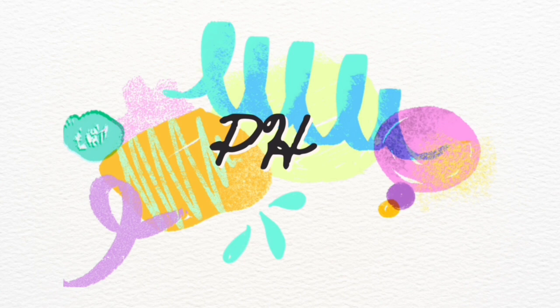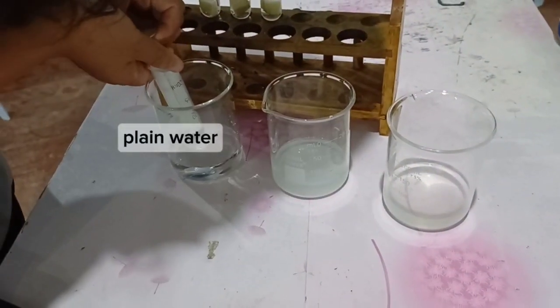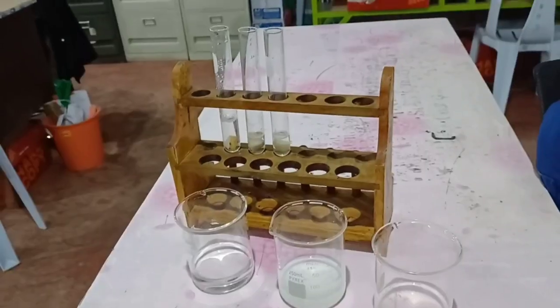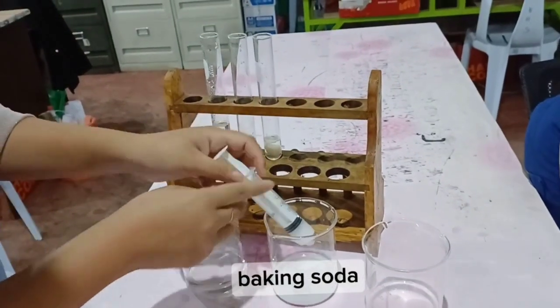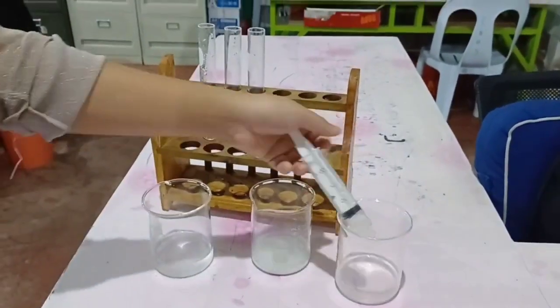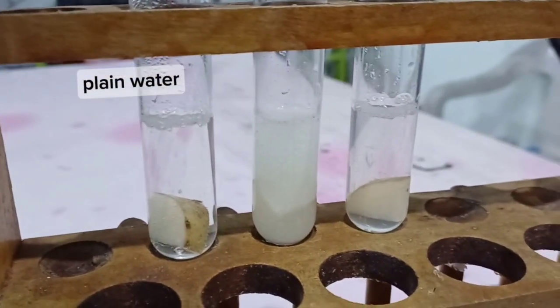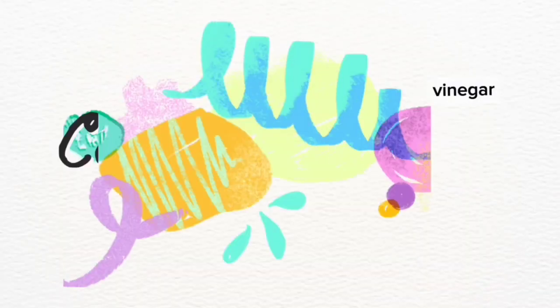Next, let's test the pH. Place potato pieces in separate test tubes. Add 5 milliliters of plain water in one tube. Add 5 milliliters of a baking soda solution. Add 5 milliliters of vinegar to one tube. For pH, catalase works best at a neutral pH. Acidic or basic conditions can reduce activity.